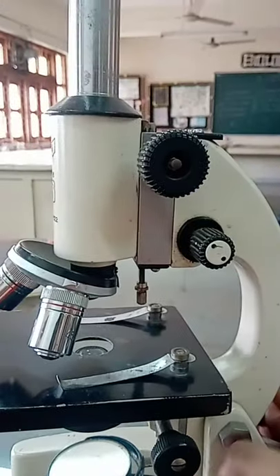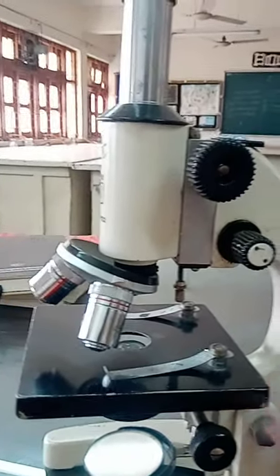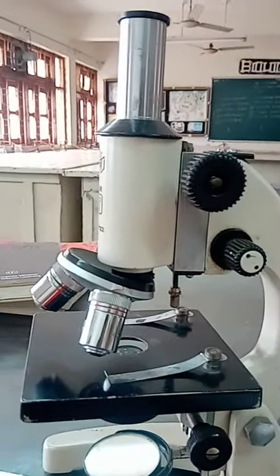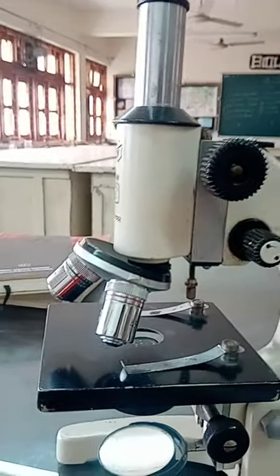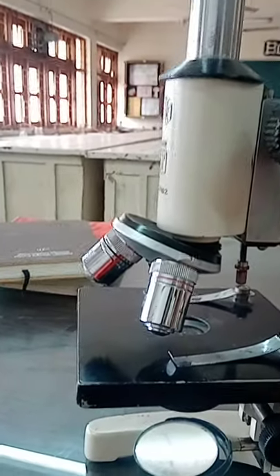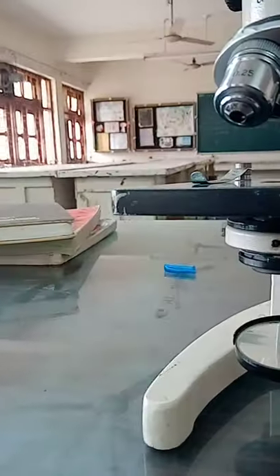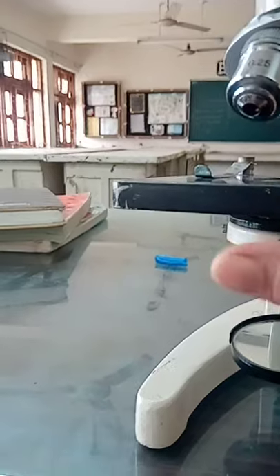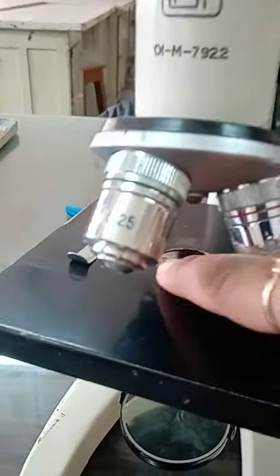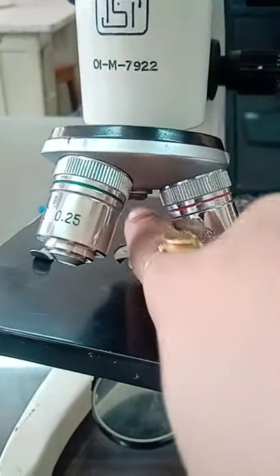There is one condenser. It is found below the stage. Its function is to regulate the amount of light entering into it. This is the condenser.